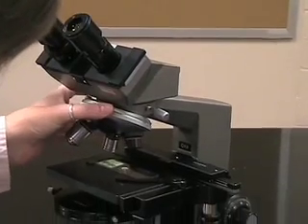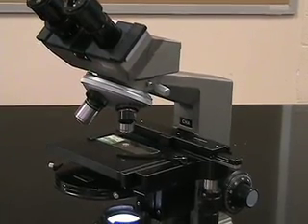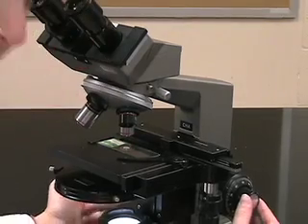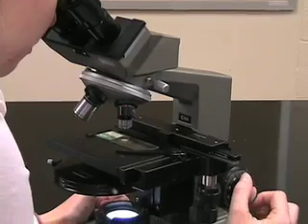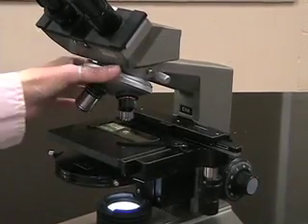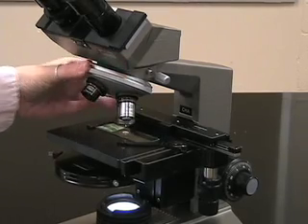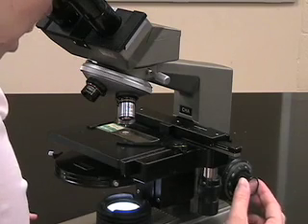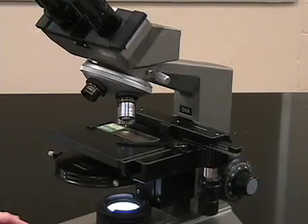After focusing on your image, you can rotate up to the next highest power objective lens. At this point, do not touch the coarse focus knob — only use the fine focus. Readjust using the fine focus until you find a nice crisp image. If needed, you can rotate up to the 40x objective lens and again, using only the fine focus knob, adjust accordingly for your specimen.